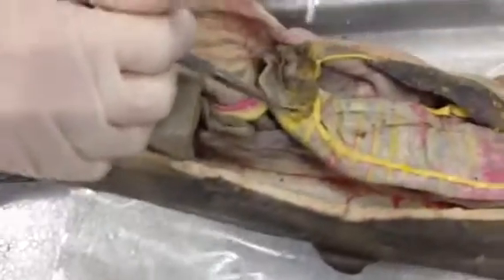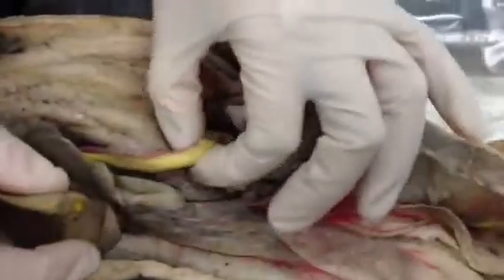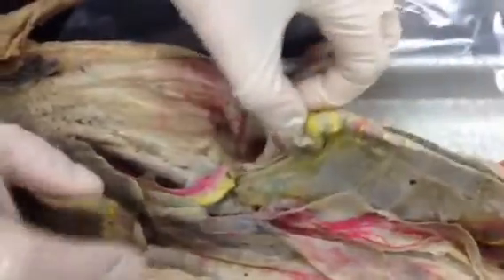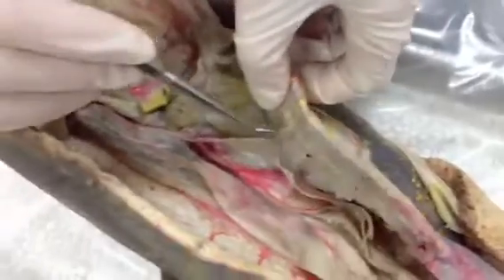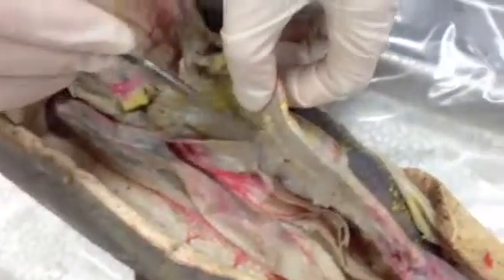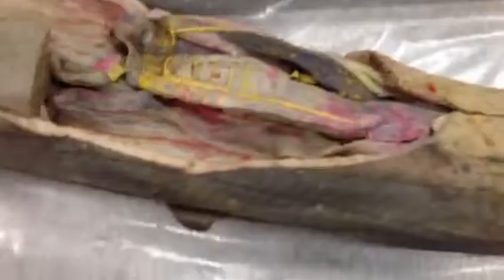The bile duct is how bile goes from the liver to the intestines. Mine's injected and it's yellow here. If you lift it up further you can see that it goes to the intestine.